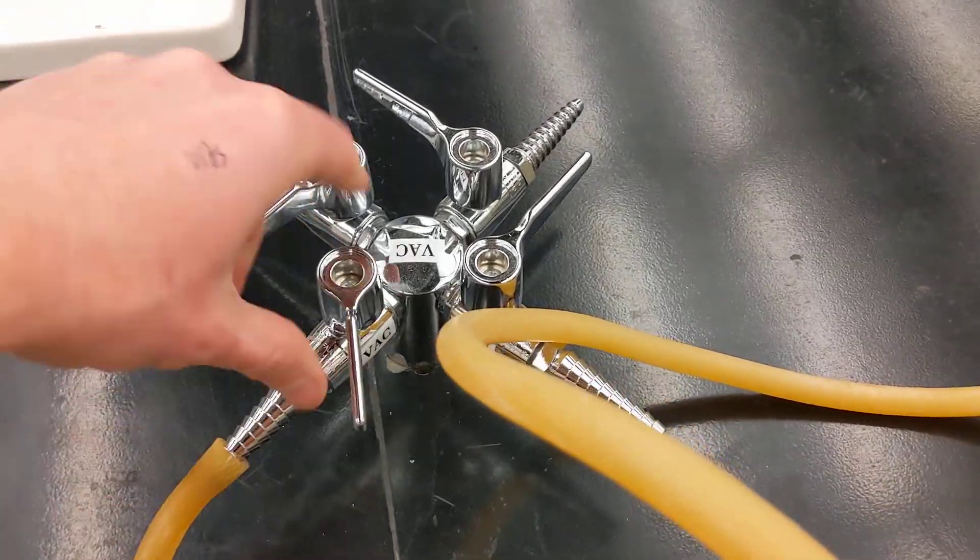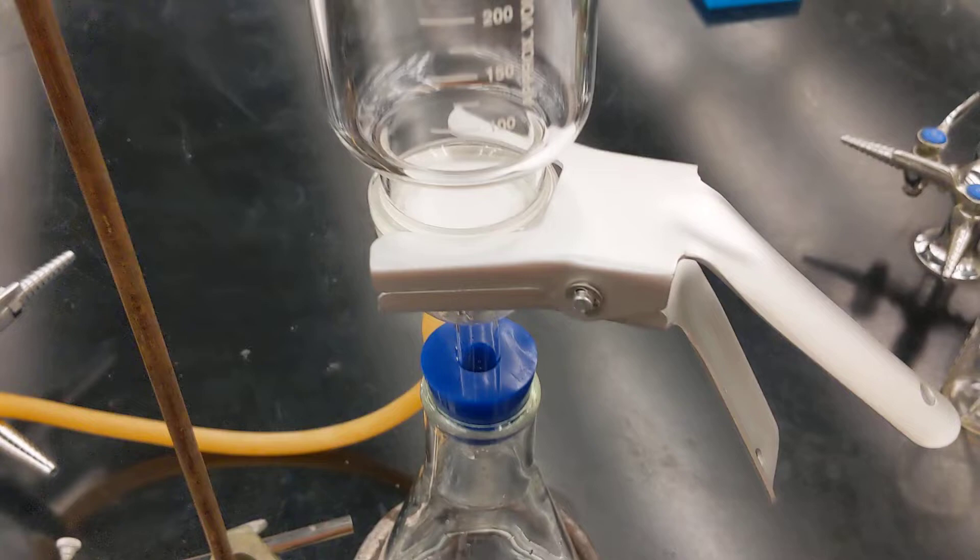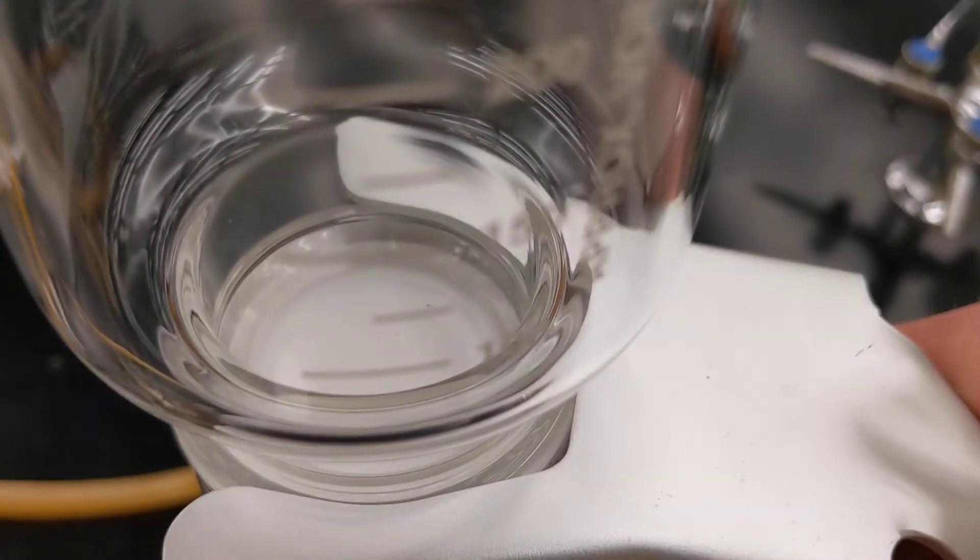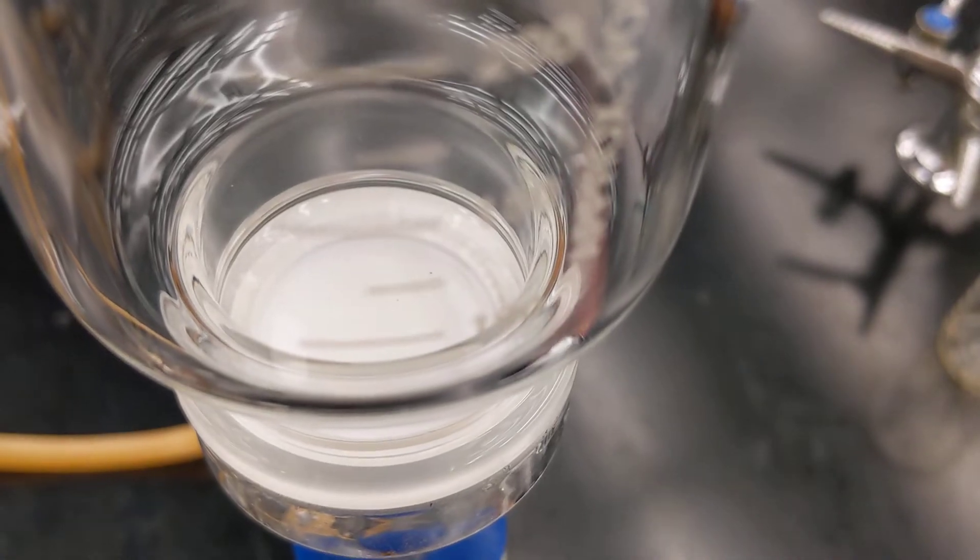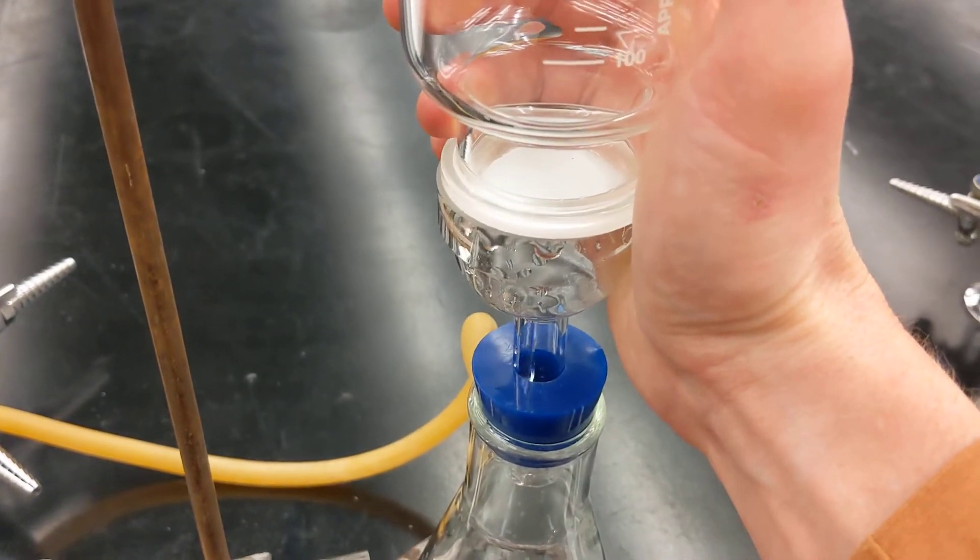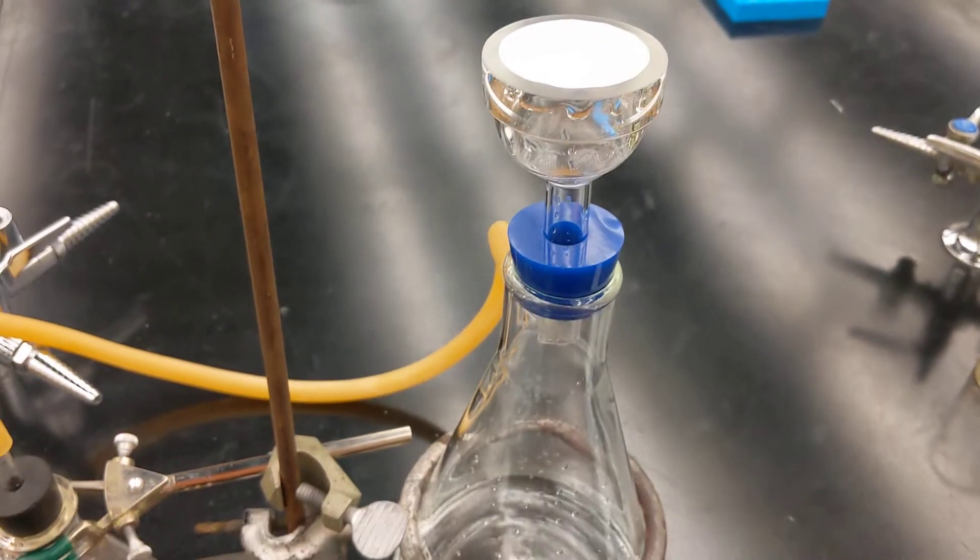Okay, so filtering is done. Go over here, turn off my vacuum so it's right angle to the line. Now I'm going to look at this object up here and pull this off. What I like to do is with two hands, just rock this back and forth and that's all it did to break that seal. That was a pretty nice one.